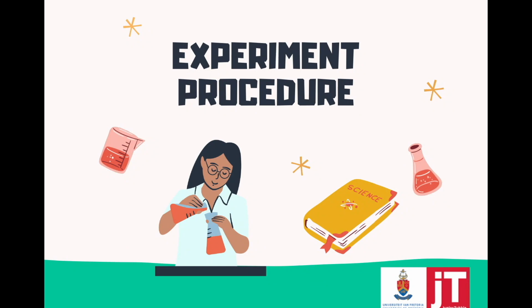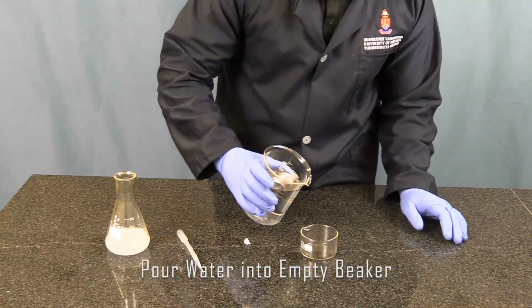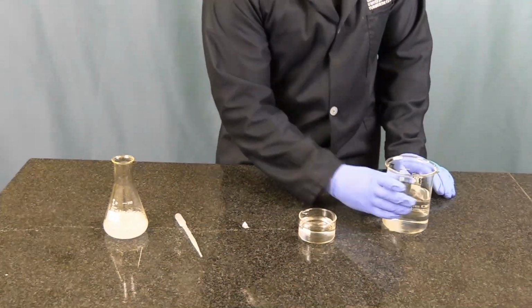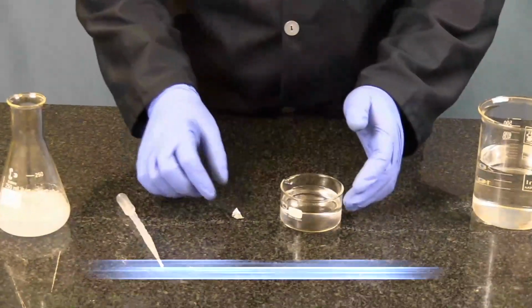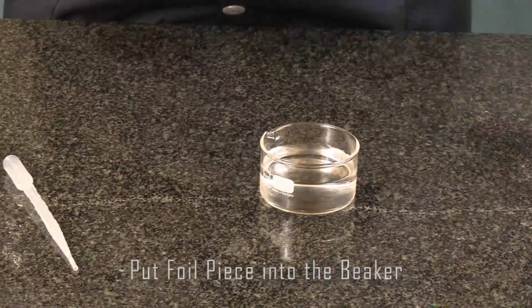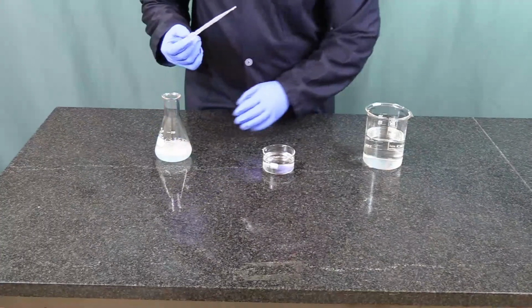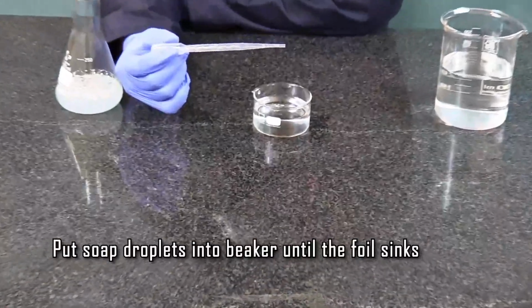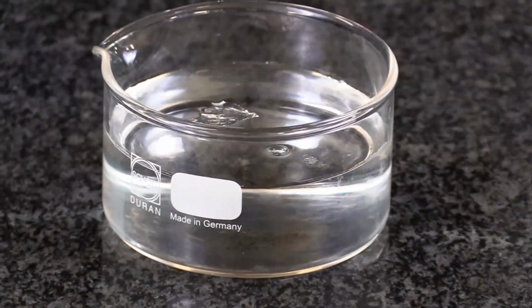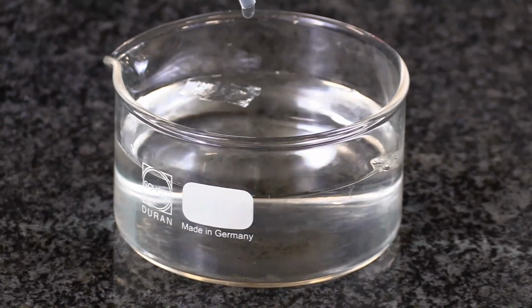So let's get into the experiment. I'm gonna carefully pour the water into the empty beaker. Now I'm gonna take the foil piece and put it into the small beaker with water. Now I'm gonna put the soap droplets into the beaker until the foil sinks. In a way, I'm trying to change the water properties by adding the soap. So we're gonna do this until the foil sinks.